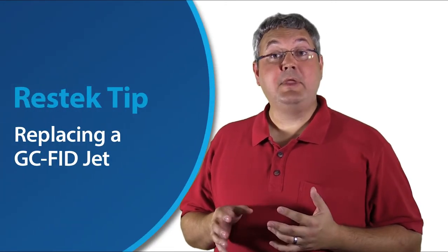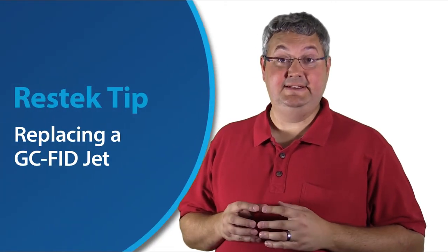In this video, we are going to replace an FID jet. This is a relatively common piece of routine maintenance that we need to do on our instruments because our FID jets can get contaminated or even clogged over time.